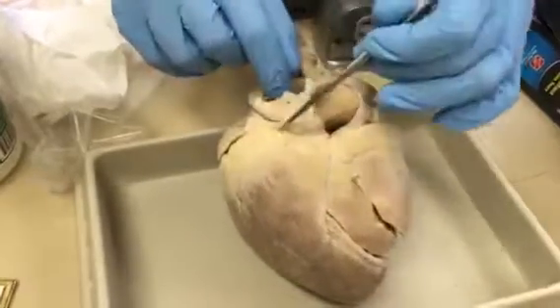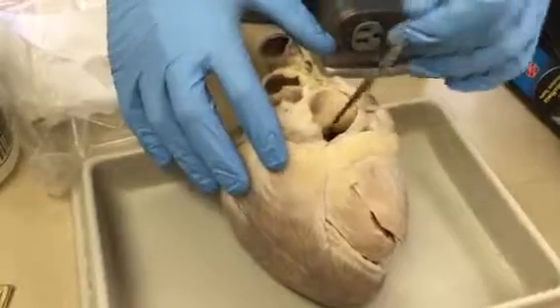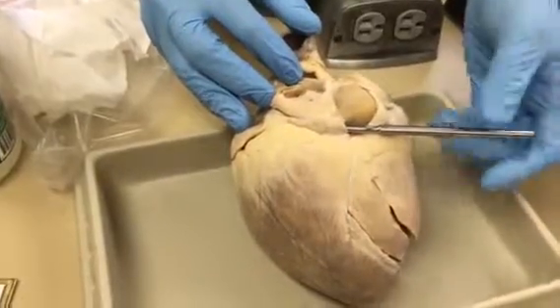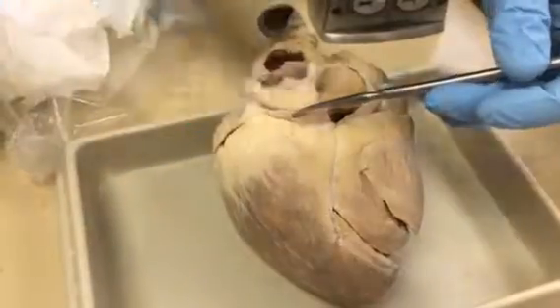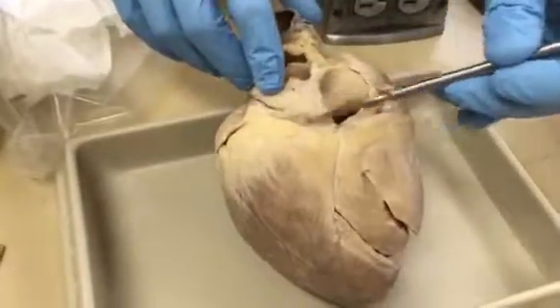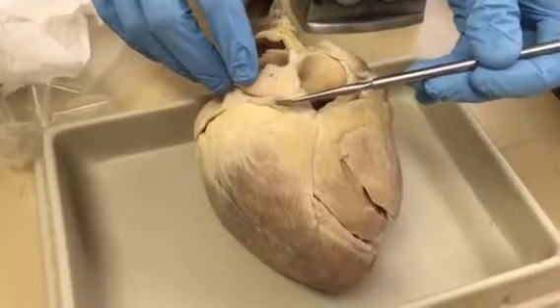This drains deoxygenated blood from the heart into the right atrium, and the opening is right there, so you can see that I've just put it in. We're now inside it. Again, if I were to pin there and ask what vessel, you'd say coronary sinus. If I asked what structure, you could say either the AV groove or the coronary sulcus. Either of those is okay.